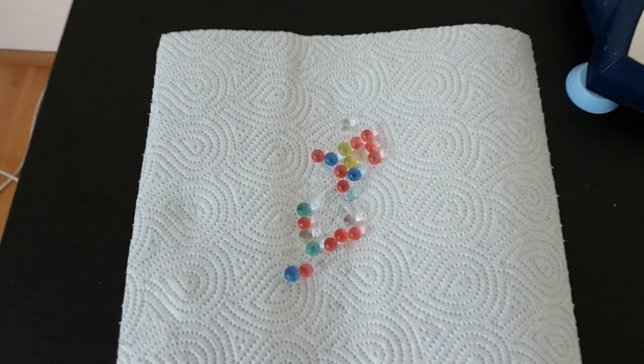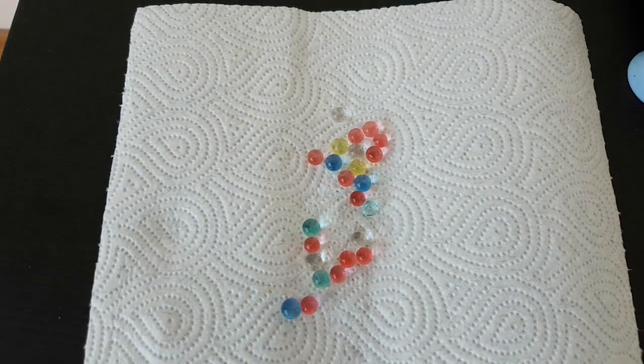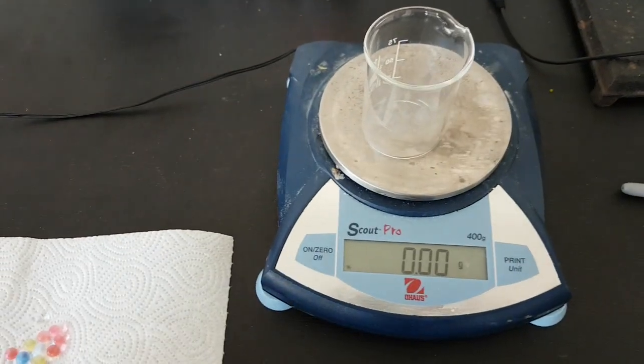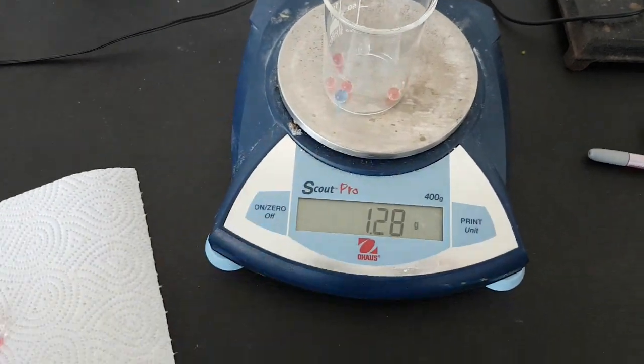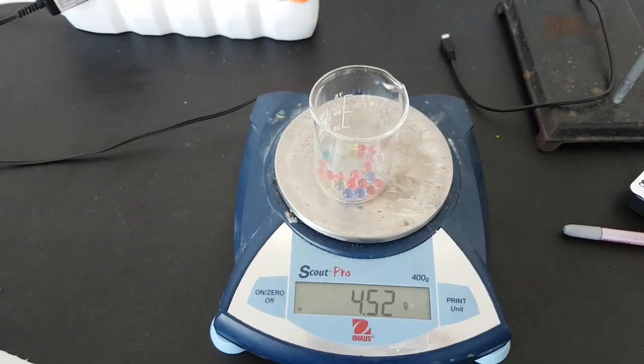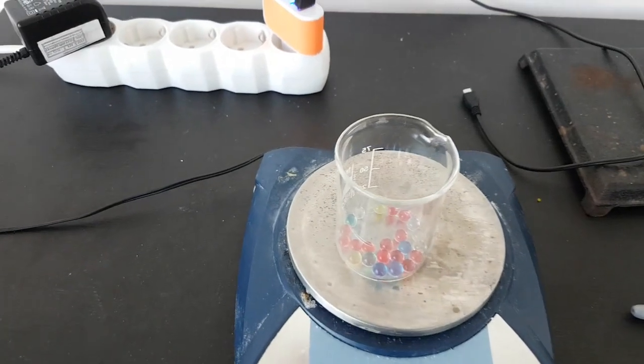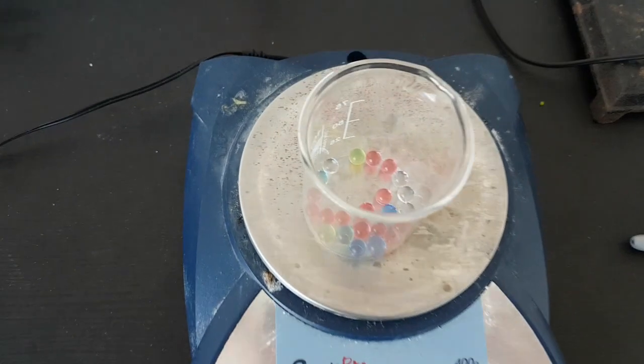Okay, so I've taken the excess water off of the hydrated polyacrylate beads and now I'm going to remass them. So that's 4.52 grams and there's 23 fully hydrated beads there.